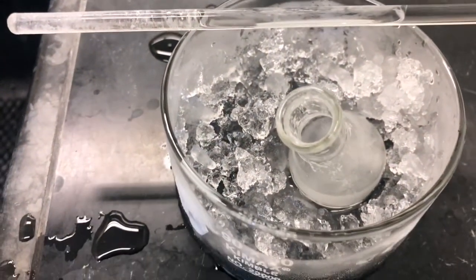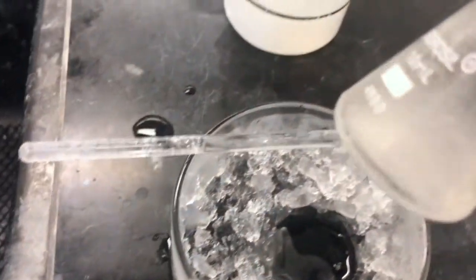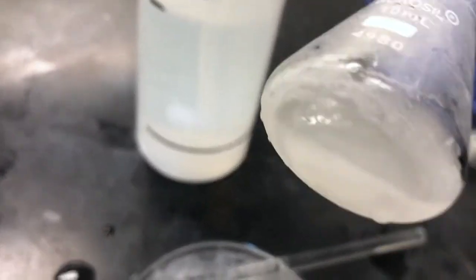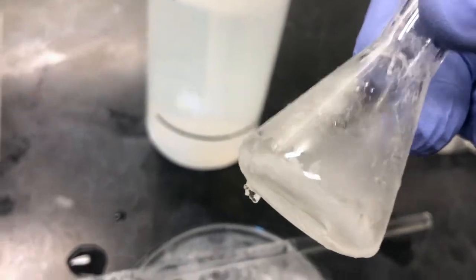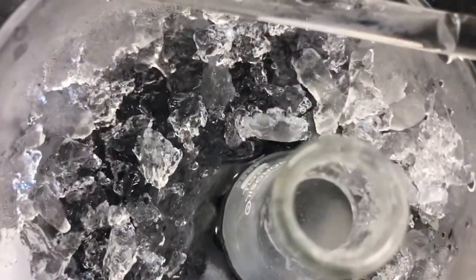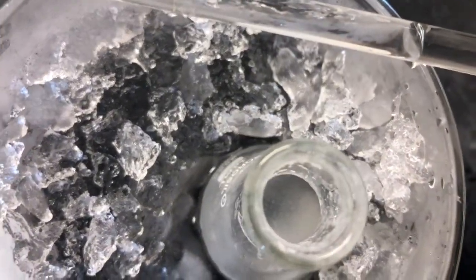Another issue is at this point, if I'd known I had used the wrong solvent, I would realize that the yield is going to be incredibly low. And I might save the filtrate, evaporate it, and then recrystallize it again from the correct solvent. But since I didn't know I had made that error during the filming, we're going to go ahead and let that finish crystallizing. Let it sit on the ice for probably 15-20 minutes and filter it.